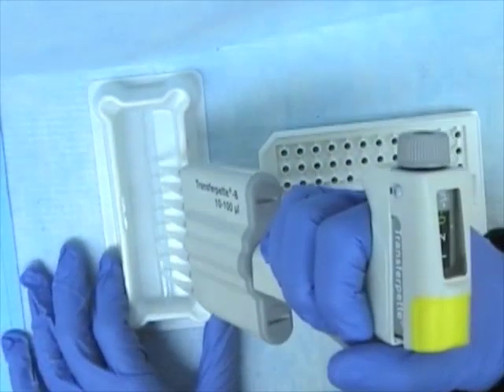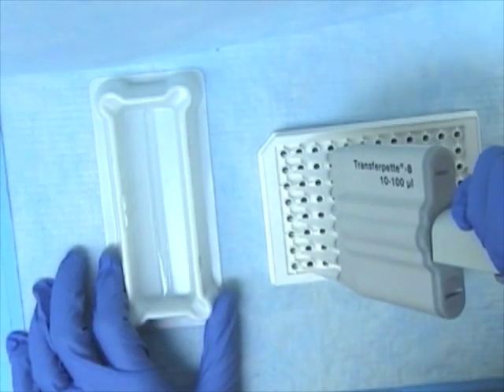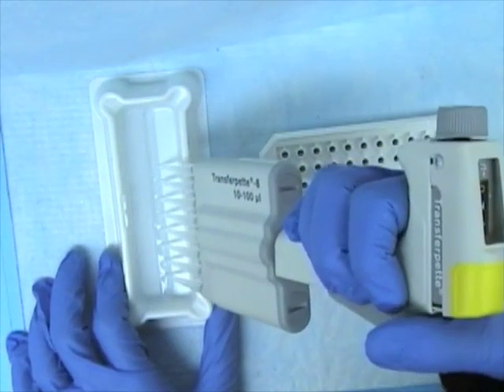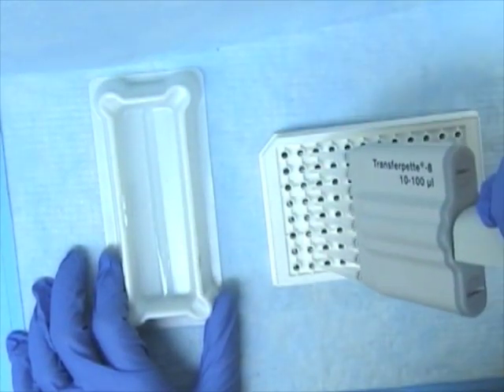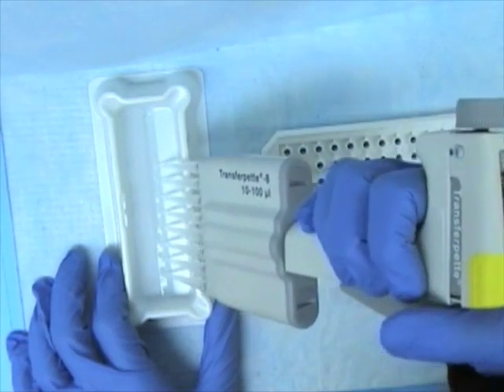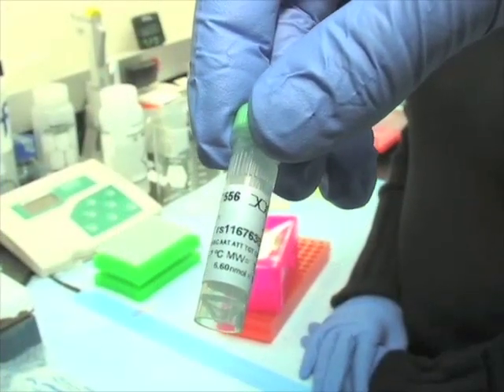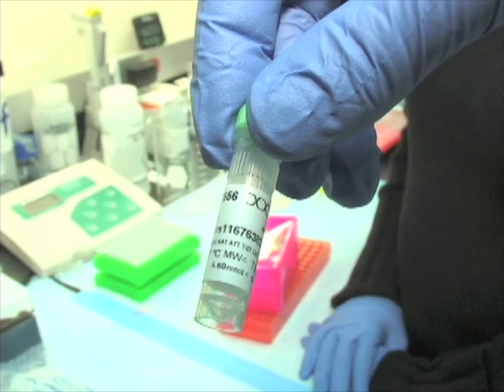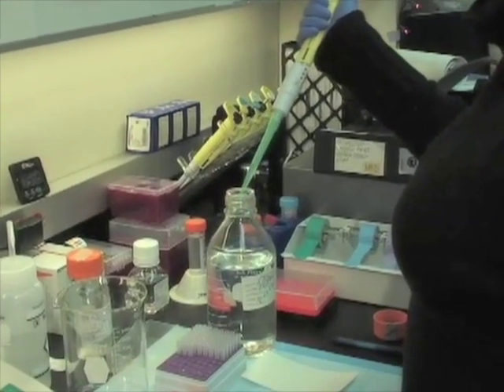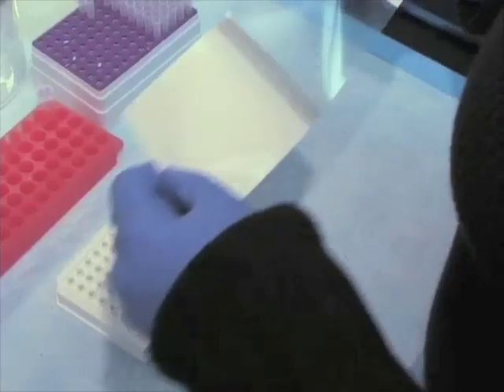To make the pyrosequencing plate, add 12 microliters of the pyrosequencing primer mix to the 96-well pyrosequencing plate. This requires a mixture of 43.2 microliters of the internal primer along with 1,396.8 microliters of annealing buffer.